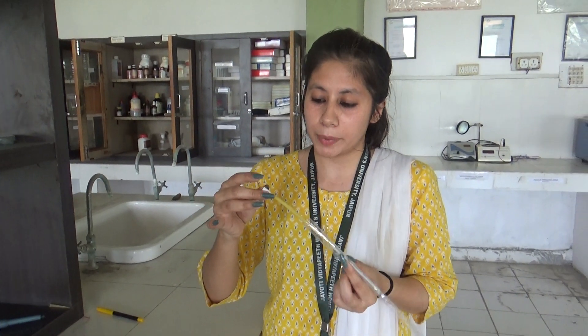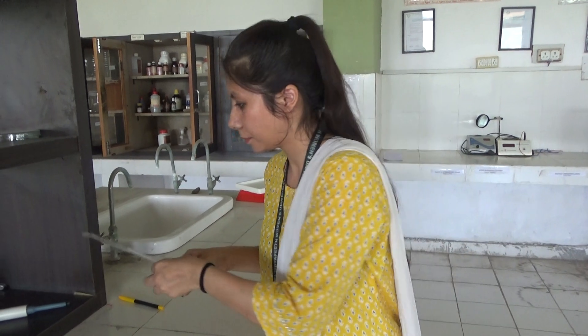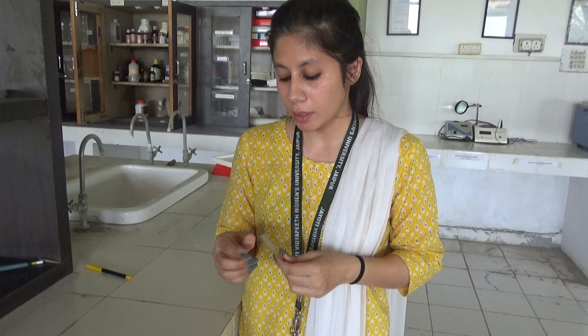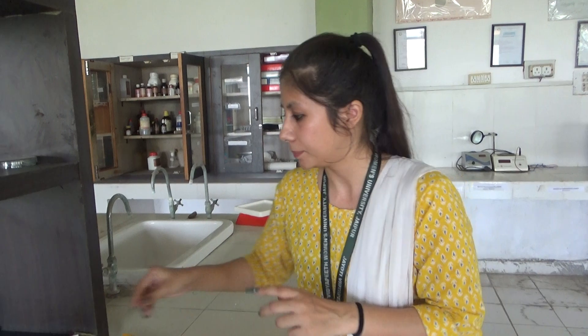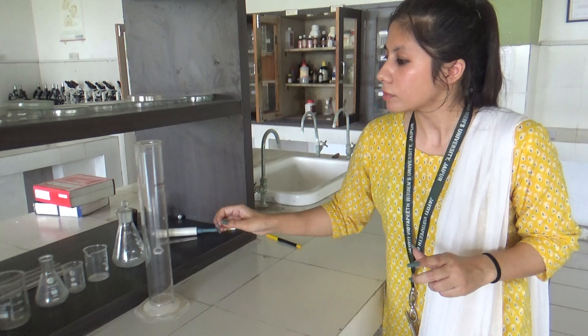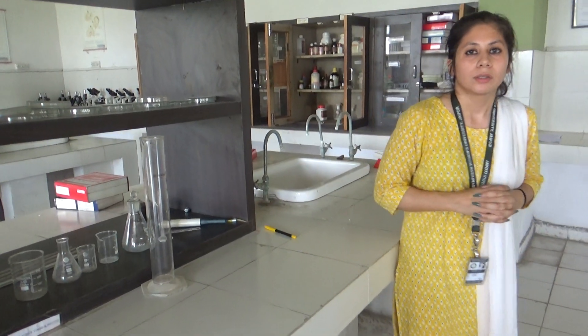Next we come to another type: tubes. Some tubes are hard and some are soft, available in the pathology laboratory. These are tubes that are open from one side. The basic difference between a pipette and a tube is that pipettes are open from both sides, while tubes are open from only one side. So these are today's topics. Thank you.